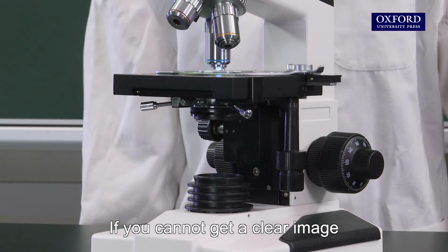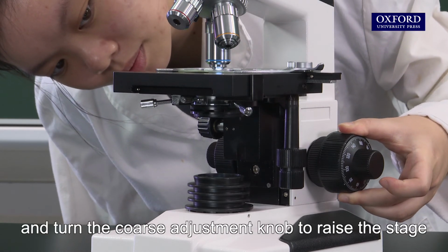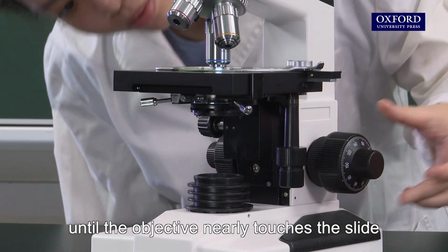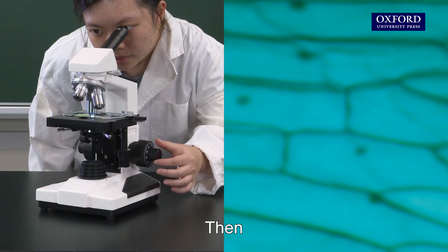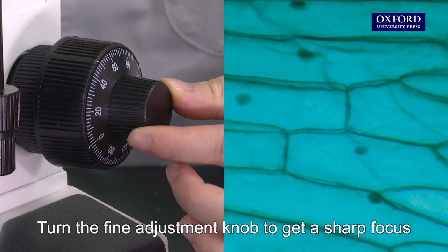If you cannot get a clear image, watch the stage from the side, and turn the coarse adjustment knob to raise the stage until the objective nearly touches the slide. Then look through the eyepiece. Turn the fine adjustment knob to get a sharp focus.